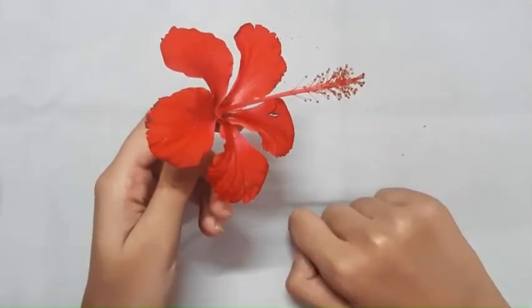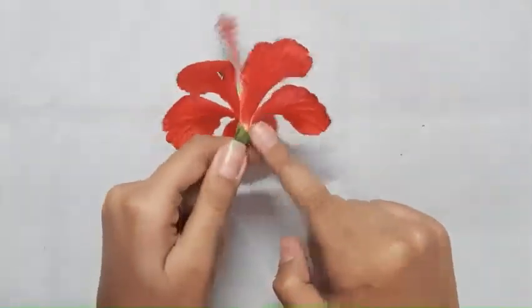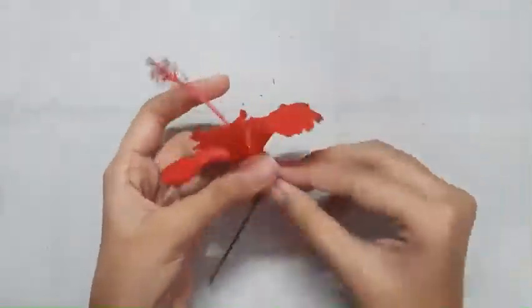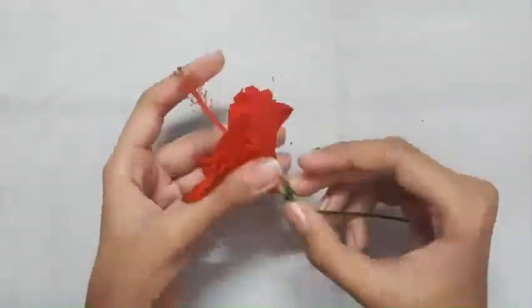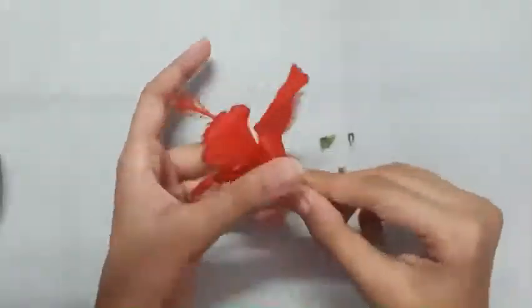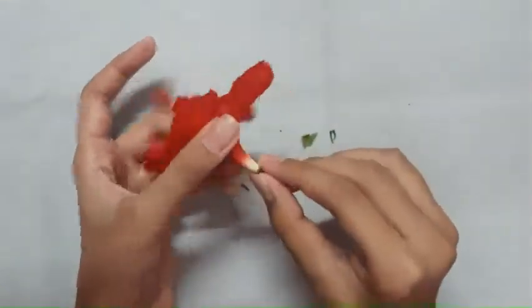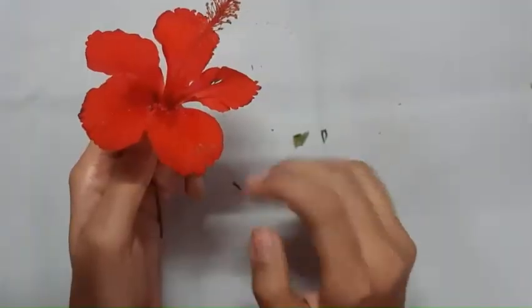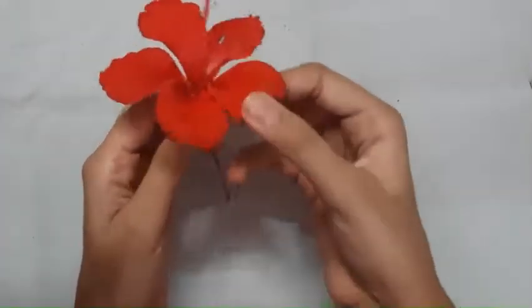So firstly, we will take out the sepals. Next, we will remove the petals of the flower.